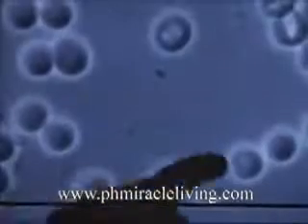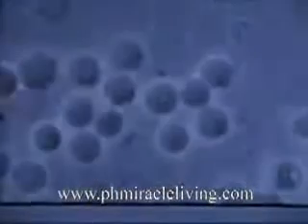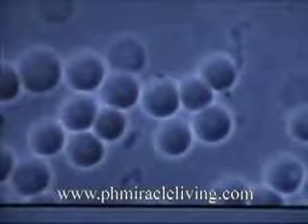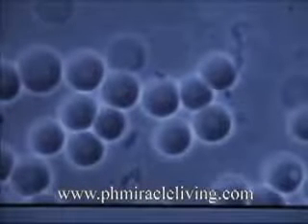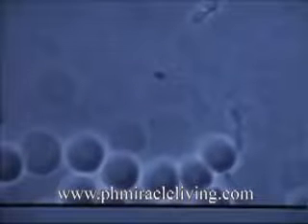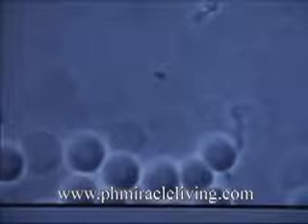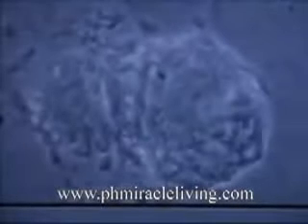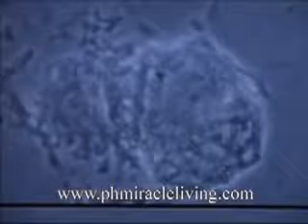Here we see the fermentations of the red blood cells, very typical in type 1 diabetics. And we see the fermentations here in all these red blood cells. These would be the size here. These are a little bit smaller microcytes. These are more normal red blood cells. And these here are all called shadow cells. A deficiency in the bilipid membrane and a deterioration or disintegration of the lipid membrane, where the cells have lost their oxygen, as if someone had turned the lights out on the cell.